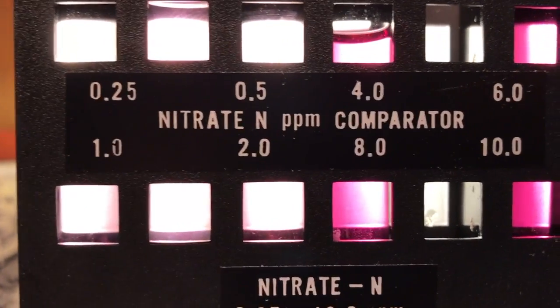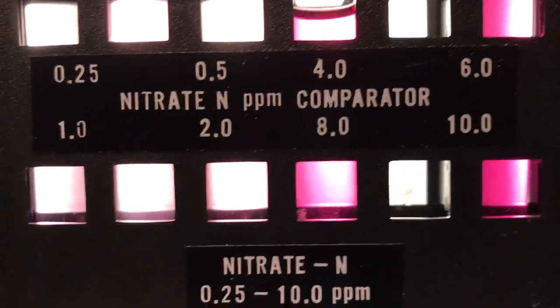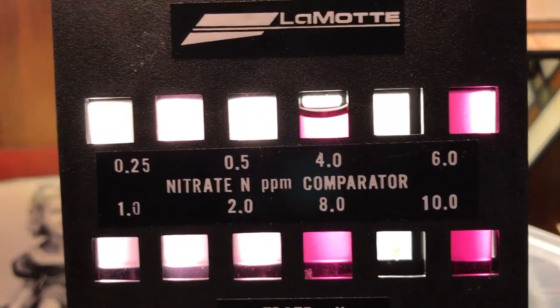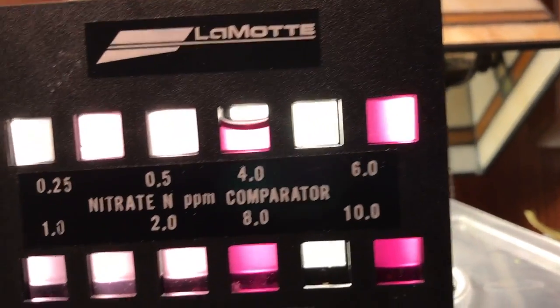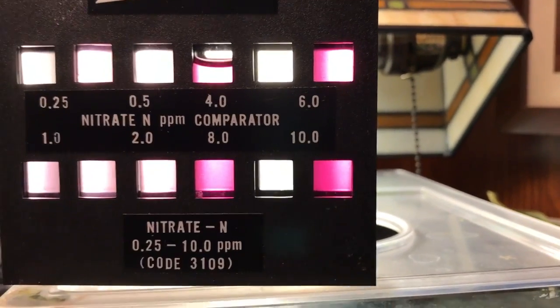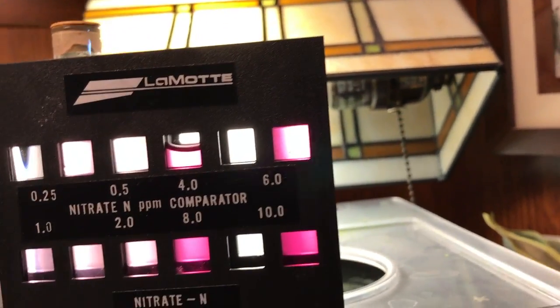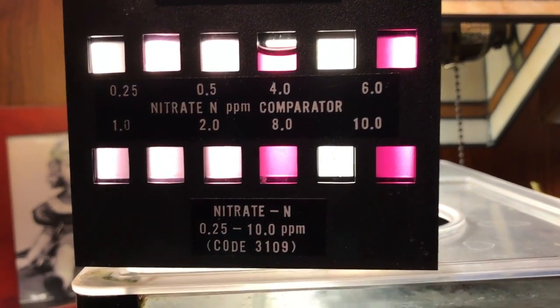Of course you're only going to be subject to the water coming out of your tap. If your tap water is between two or less parts per million, you've got good tap water. This is nine-month-old water — I've probably exchanged maybe 30 gallons total in nine months. And you wonder why the discus are doing good: there are no nitrates, the plants are living, and I'm not adding more nitrates.